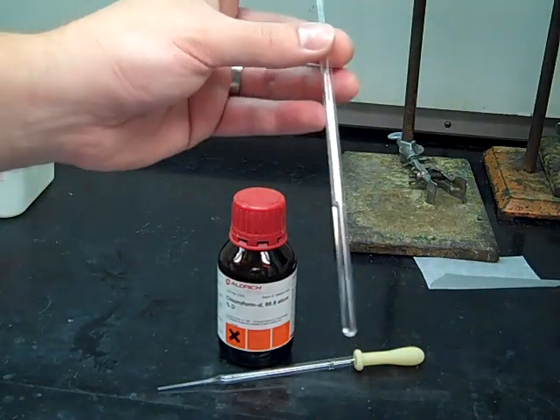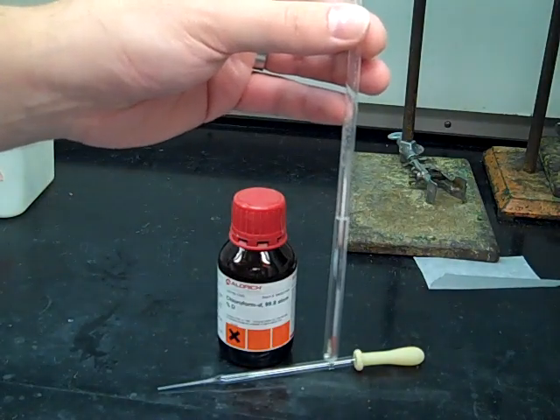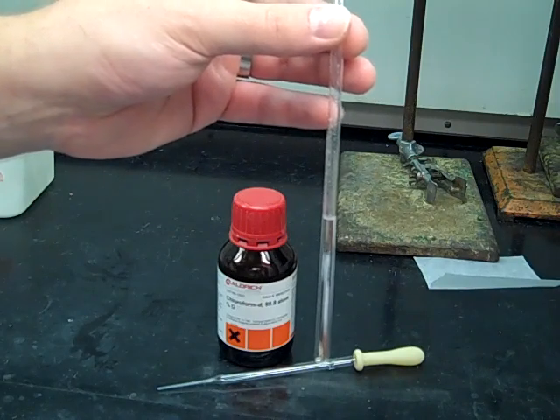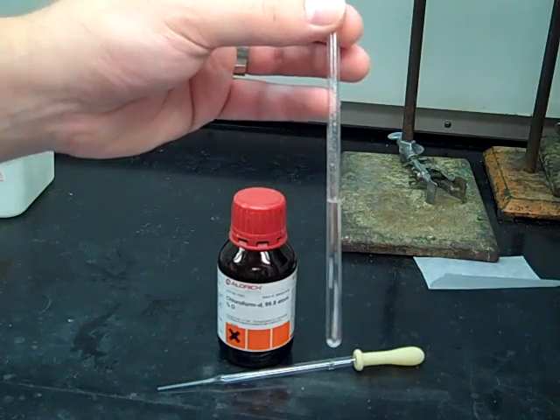So that's it. You've got your NMR sample. It's filled up to the proper height on the solvent guide and then you're ready to submit this to your TA to run the NMR. Because the NMR spectra are so important to you being able to solve the structure of your compounds, you want to make sure that you prepare your sample correctly just as we did in this video so that when you get your NMR spectrum, you're able to analyze that and utilize all that valuable data that comes out of that spectra. So hopefully you prepared it well in lab and you end up with a great spectra to analyze in your notebook. Good luck in the lab.